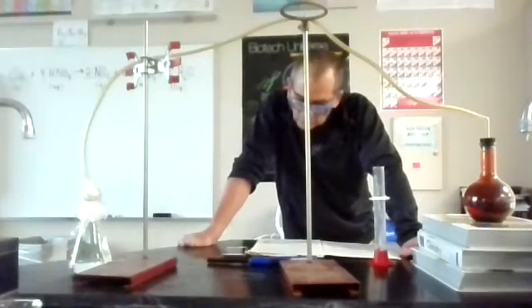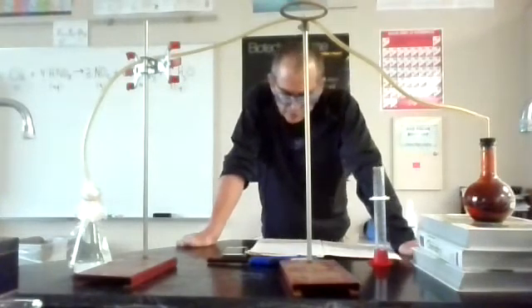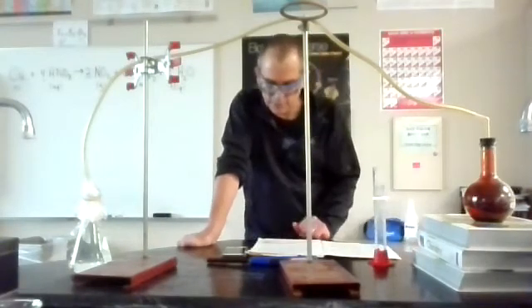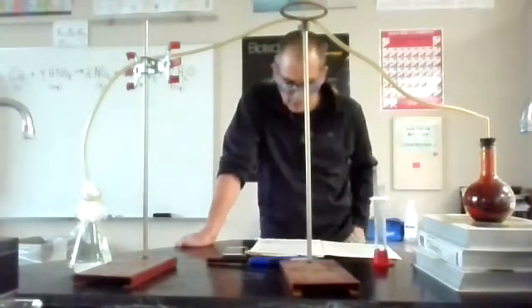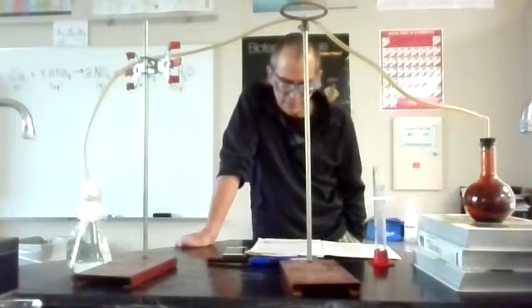The air in the neighborhood of the performance became colored dark red. A great colored cloud arose. This was disagreeable and suffocating. How should I stop this? I tried to get rid of the objectionable mess by picking it up and throwing it out of the window. A new observation: nitric acid does not only act upon copper, but it acts upon fingers.